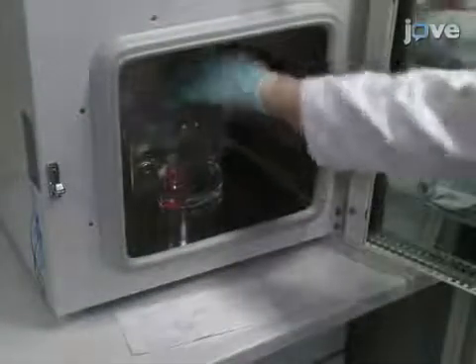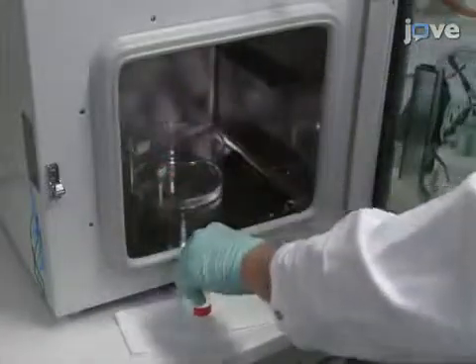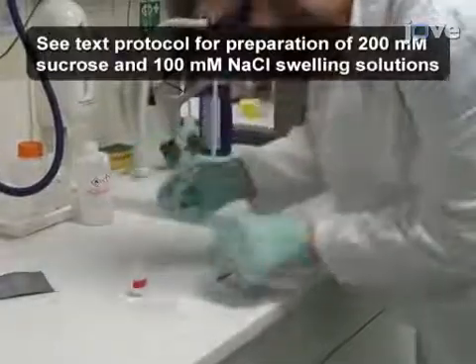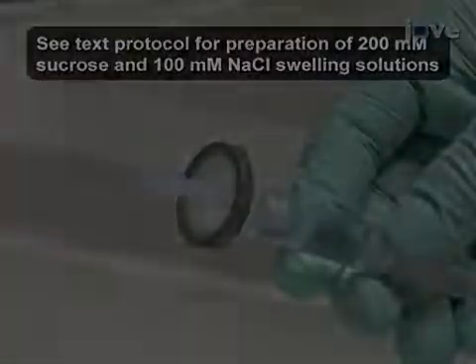Allow the lipid bilayer to pre-swell at 60 degrees Celsius for 4 hours. Then, remove the vial from the container. Draw 5 milliliters of swelling solution into a plastic syringe and attach a 0.45 micrometer filter to the syringe tip.